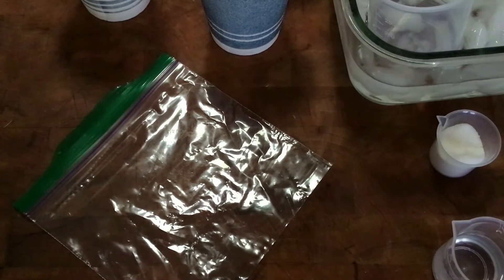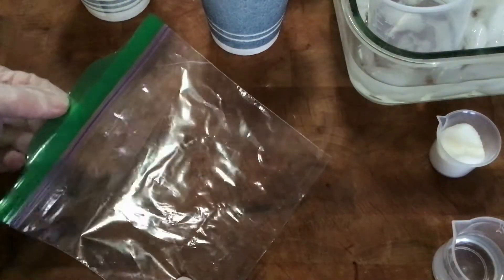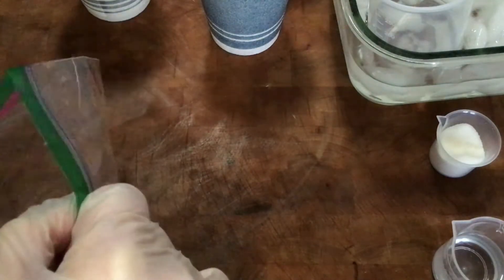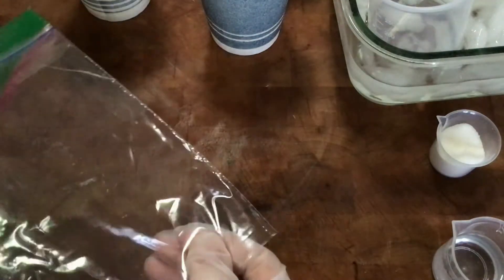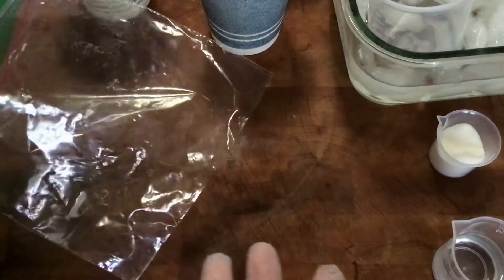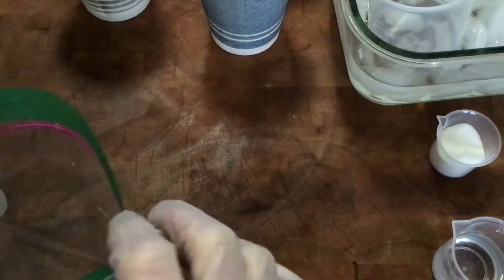This is going to walk us through the protocol for the teacher demonstration, showing students the effects of the protocol when used on other substances. The first thing they might wonder is how do we know what we got from those cells is DNA, and not just some weird combination of the soap with other stuff making that gooey substance. So we'll test some distilled water.